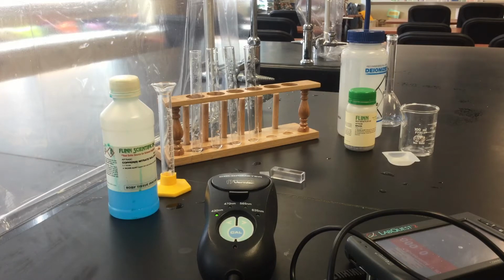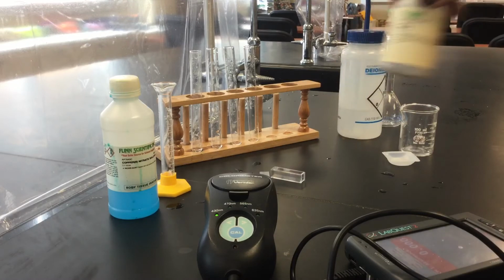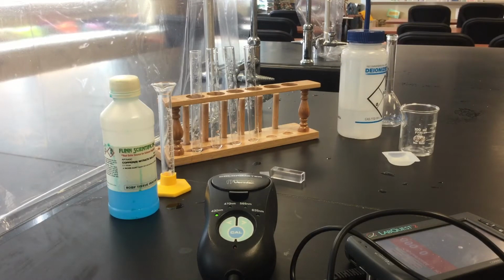And for the guided inquiry activity, I'm actually going to do part B first, get that going with the brass, because it takes a little time for the BBs to dissolve in the nitric acid. And then while that's dissolving, we'll come back and do part A so that we can make our Beer's law curve with the copper 2 nitrate. So what I have here is my brass, which is just basically some BBs.